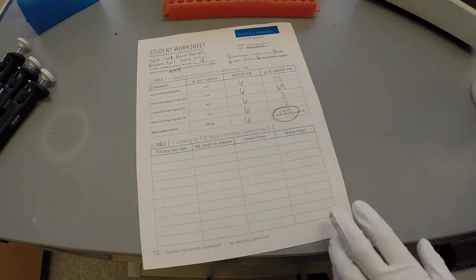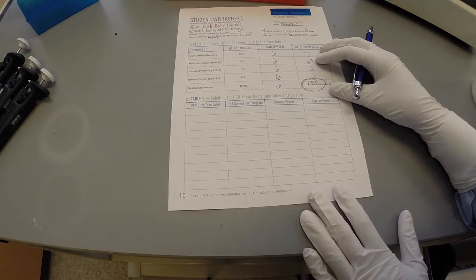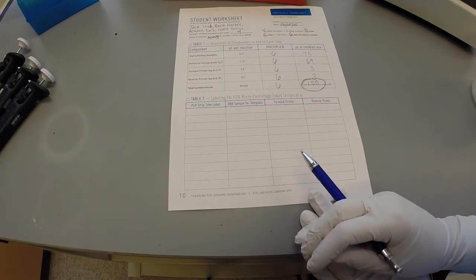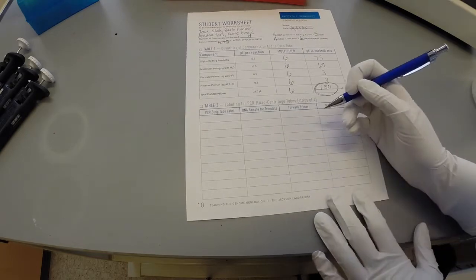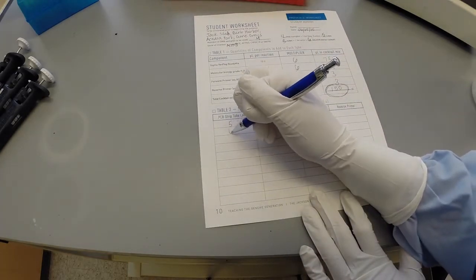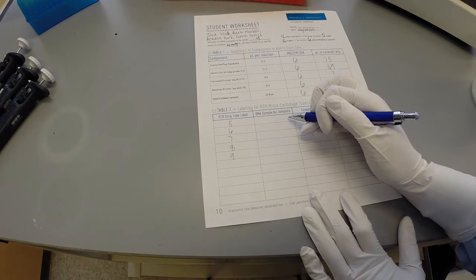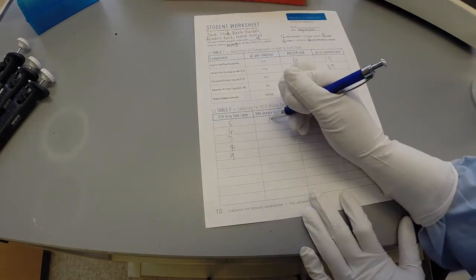Table 2 is used as a guide for labeling of the PCR samples. As indicated by the equations, this group will be using 5 tubes. The class must collectively number the PCR samples to not confuse samples amongst the groups. In this example, these students have been assigned samples numbered 5 through 9. The sample names are filled out in the second column, and the primers used for each sample are filled out in the last 2 columns.